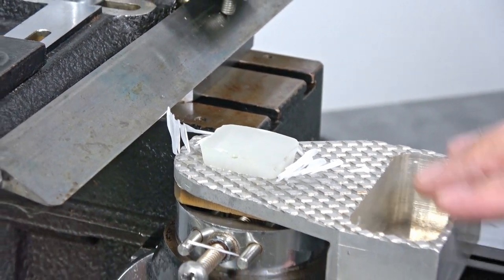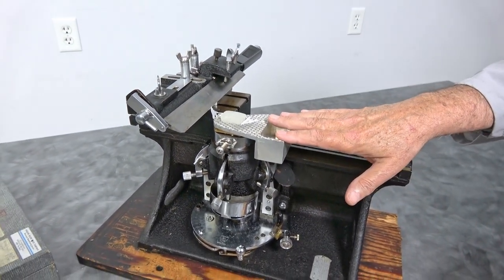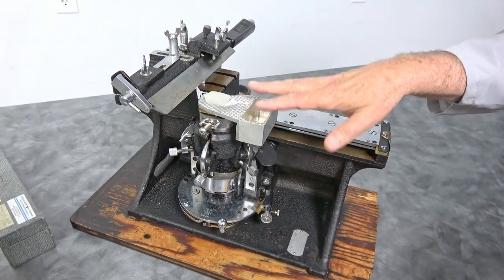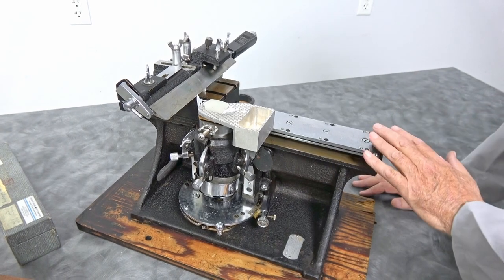This one has the dry ice, so it'll harden up your sample a little bit more. Gorgeous way it's designed and built.